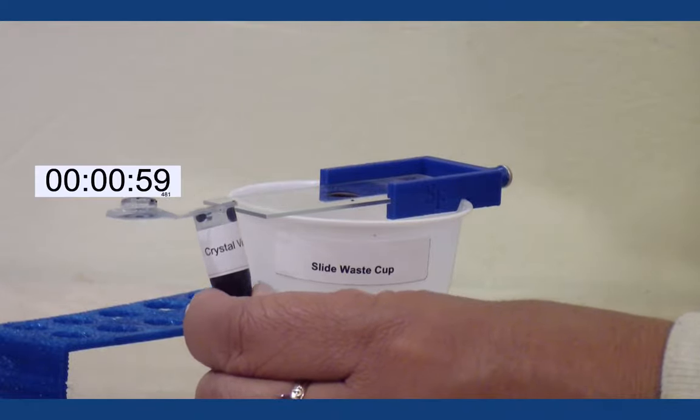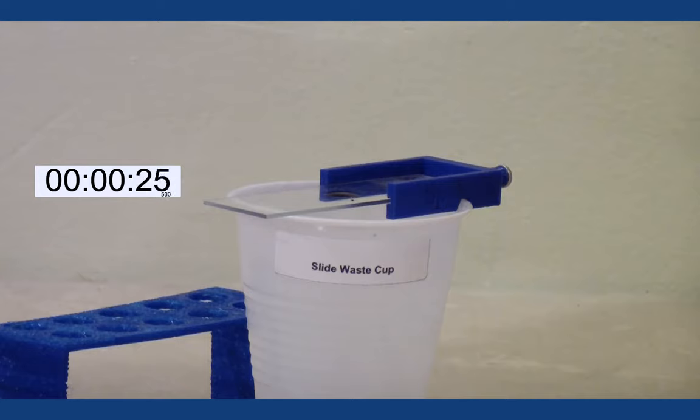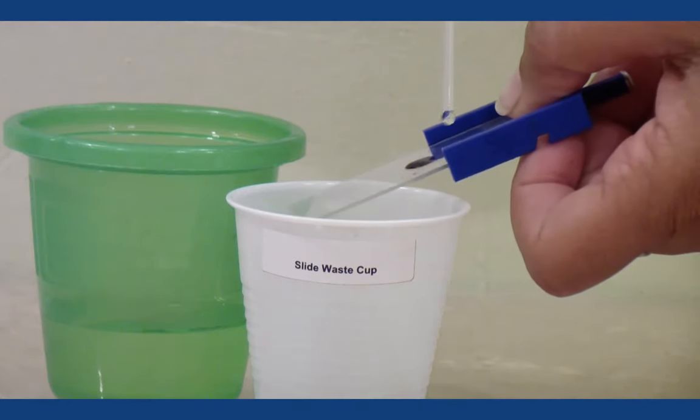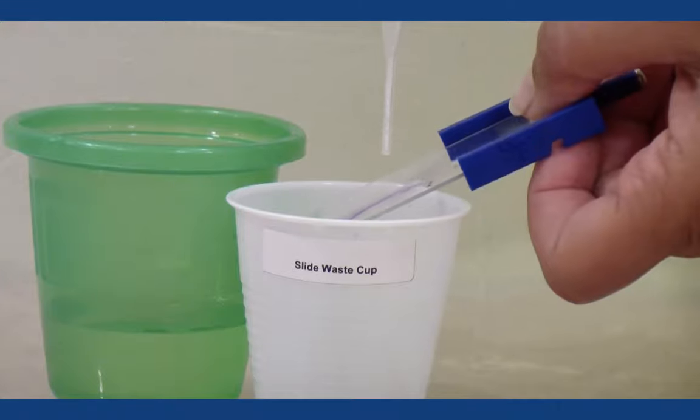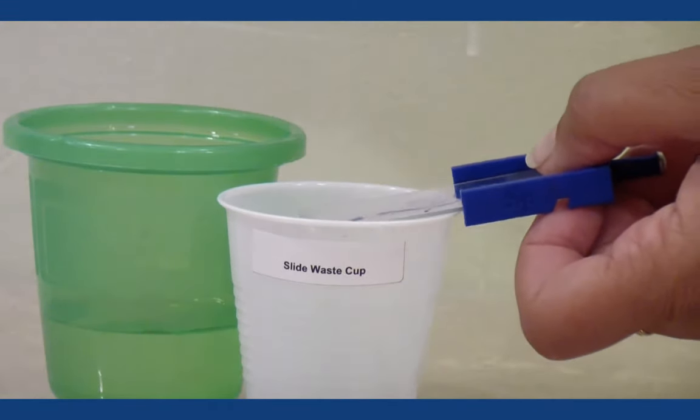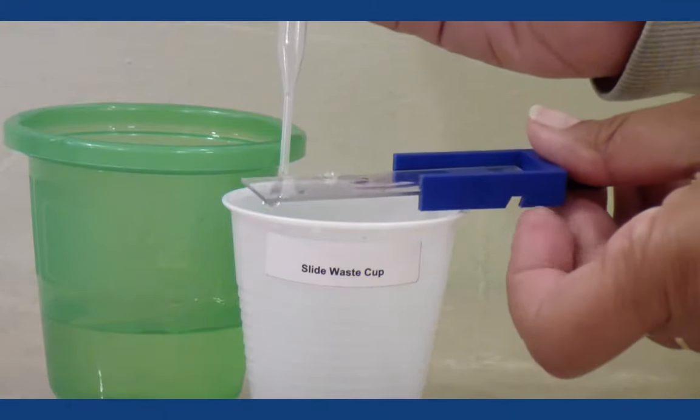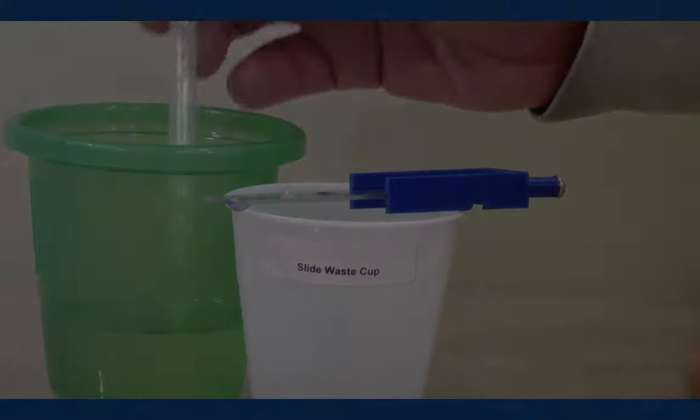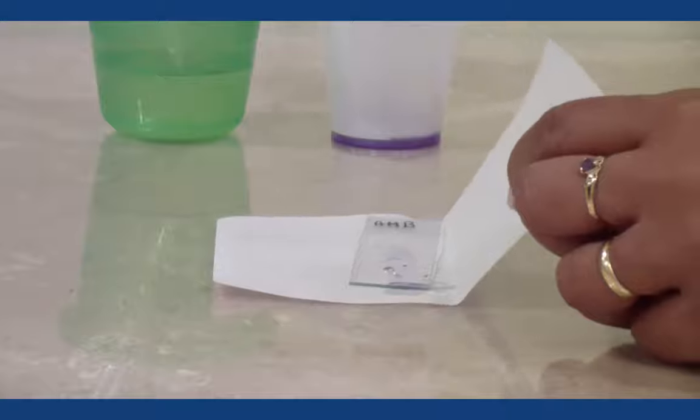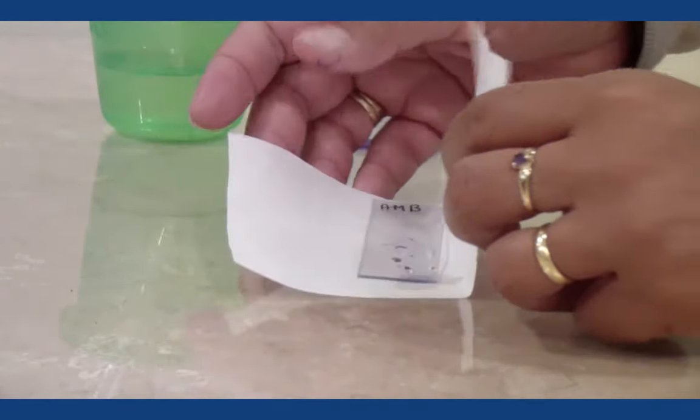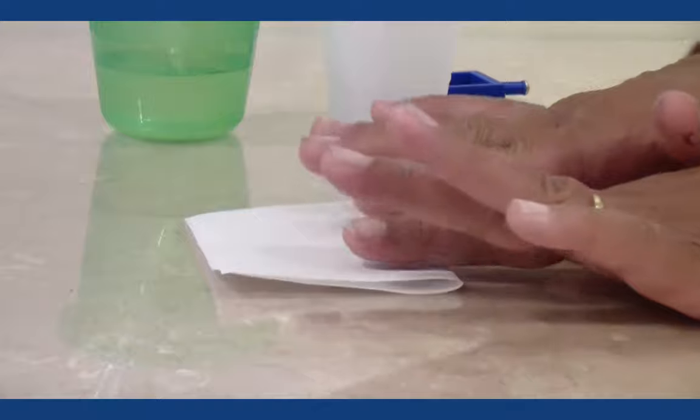Allow it to sit for one minute then rinse it with water. To rinse, just flood the smear with water and allow it to run off into the waste cup twice. You can let the slide air dry at this point but that takes quite a while. A better way to dry the slide is to open up a sheet of bibulous paper.